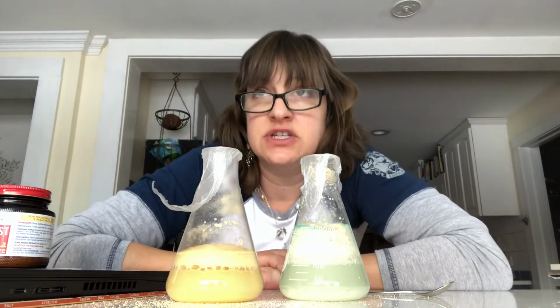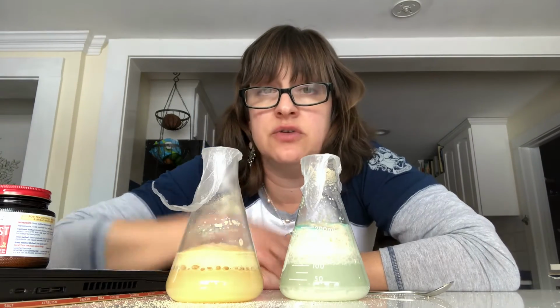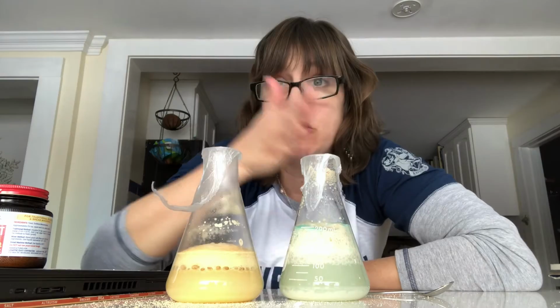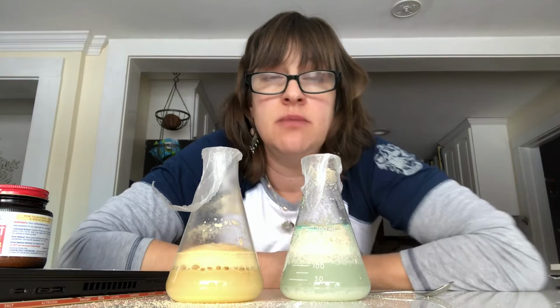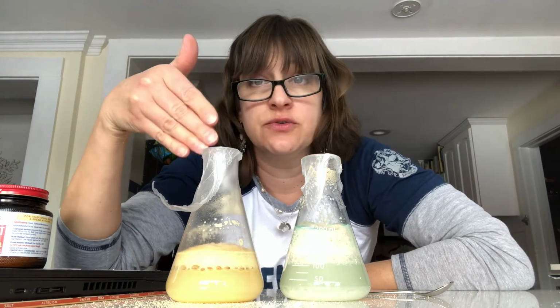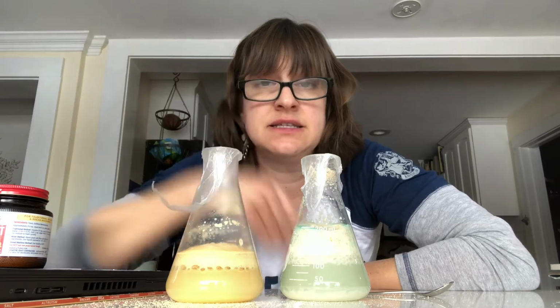So now the last thing you have to do, once you've filled in your observations, is go to the bottom of the lab, where I ask you to support a claim with evidence about that, to say that cellular respiration has occurred here. And you should be talking about both of these flasks in your responses. Now, to help you along with making sure that your message is clear in your response, you could say something like, the color change observed with the bromothymol blue indicates, and the color change observed with the methylene blue indicates.